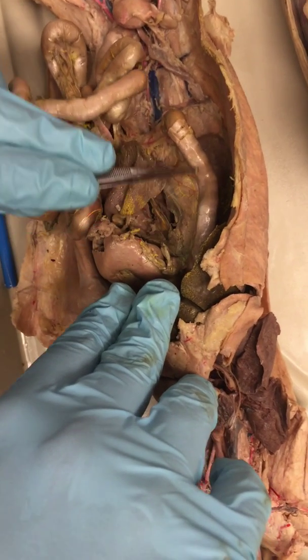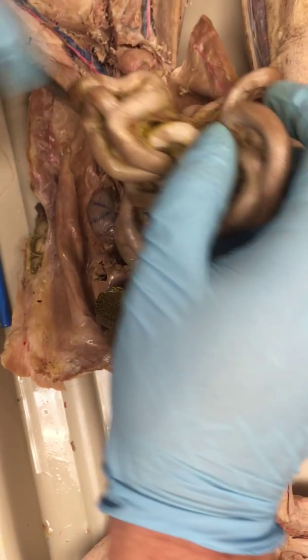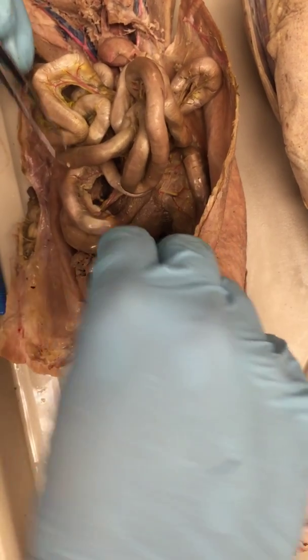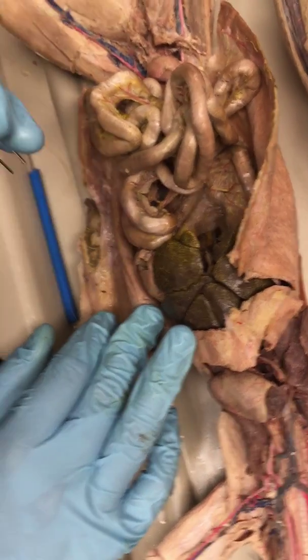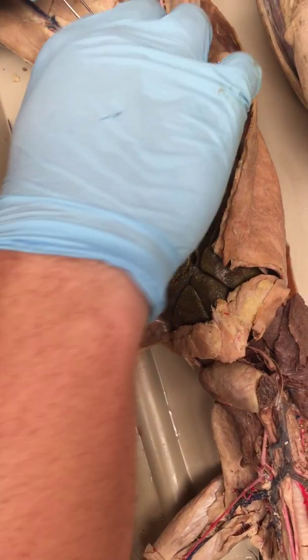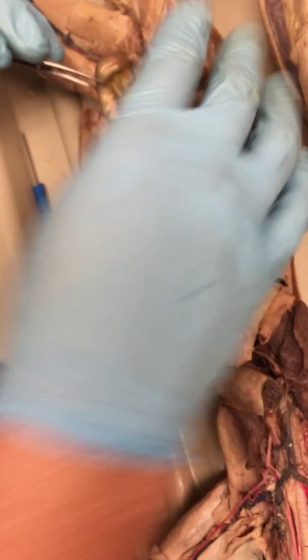Okay, so here's the duodenum of the small intestine. You'll also find at the other end the ileum of the intestine. Now, one of the things we do on the test is we'll cut out an intestine. So you'll just see a stomach, a small intestine, and a large intestine sitting on a plate. And if we do that, sometimes we'll take the middle of the intestine, which is known as the jejunum, and we'll just put a pin right there.